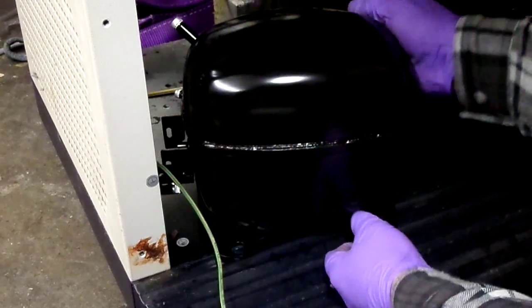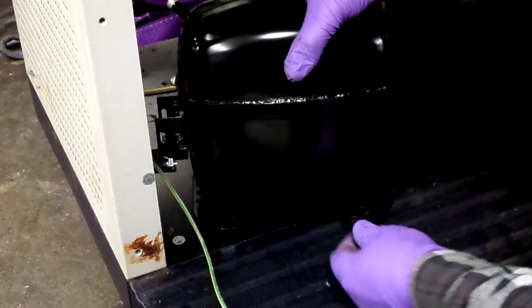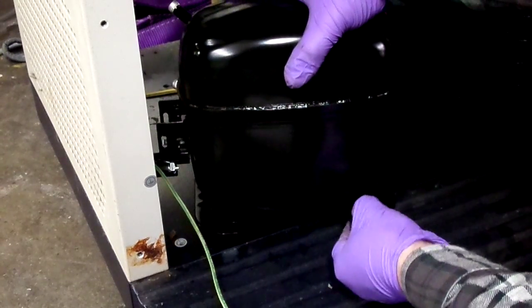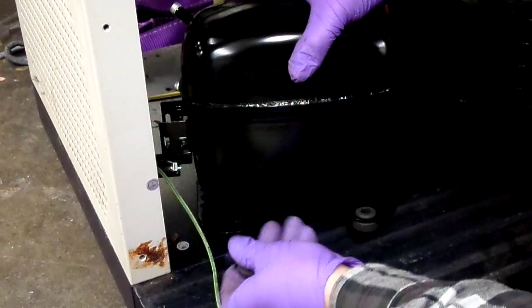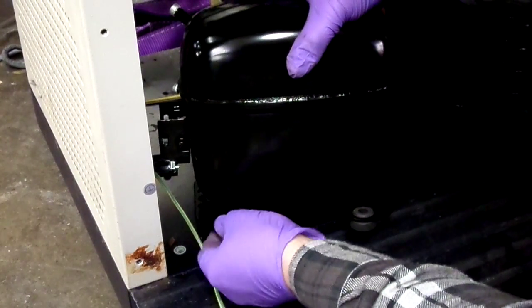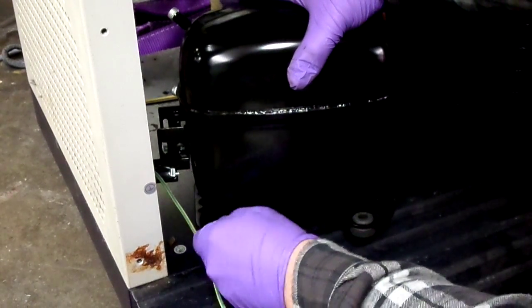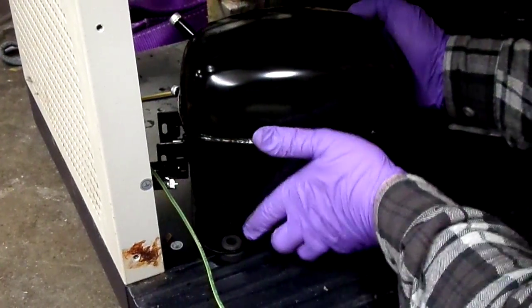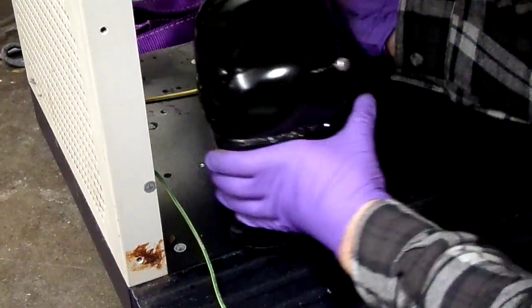That would be before you even put in the new compressor, it'd be a good idea to... Nah, never mind. I was gonna say you could put in your fan motor now, but you kind of want that shroud out of the way for the evap assembly. If it was just the compressor, then yeah, you'd swap that fan motor out now. Okay.